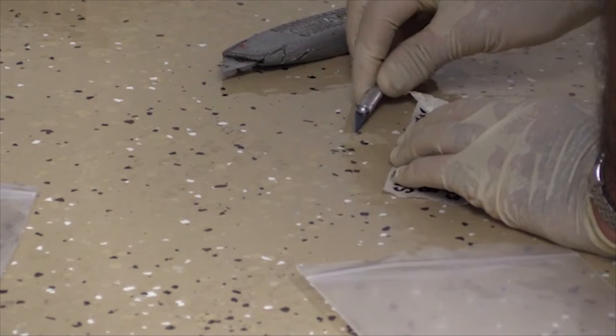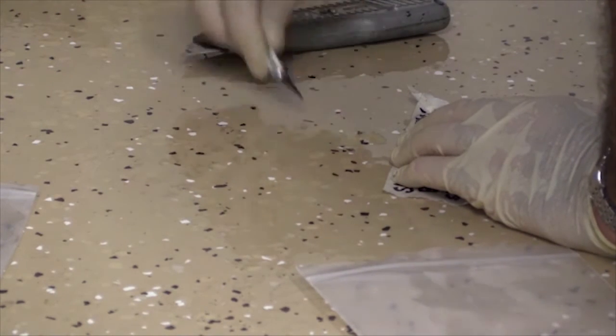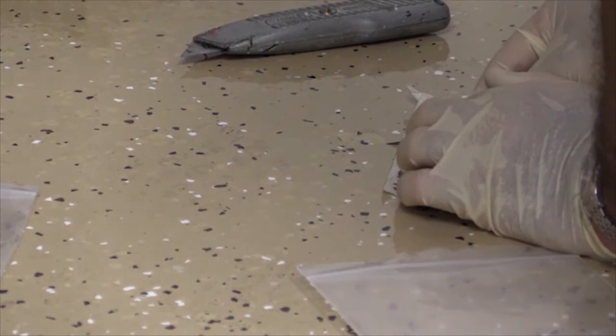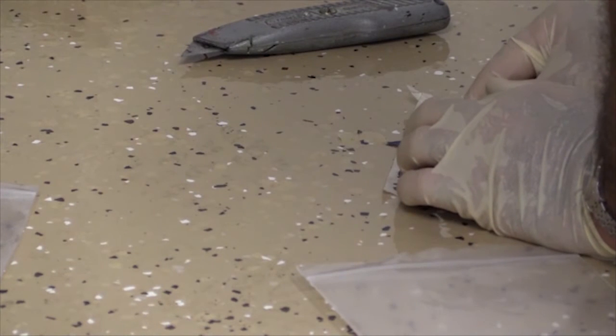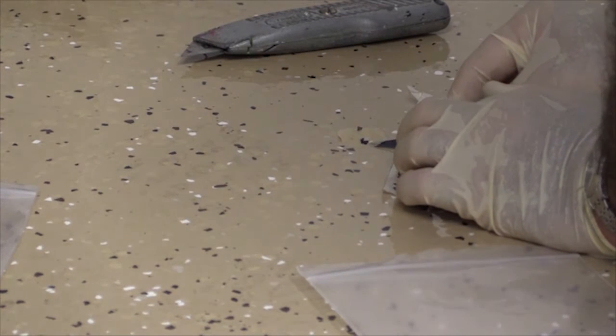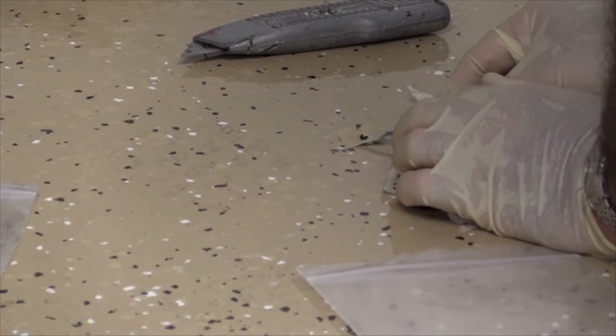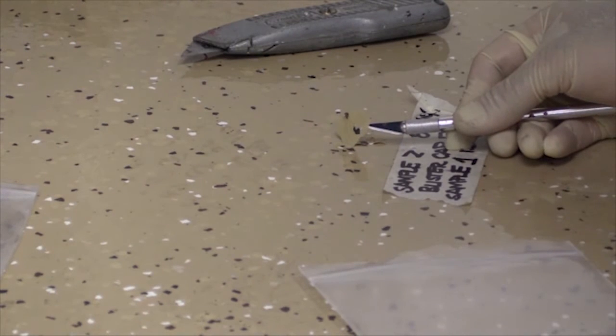And you can see it lifting. You want to take your time and be careful, because you want to get the cap intact. So there I'm cutting around, and you can see that I'm able to lift the blister cap now.